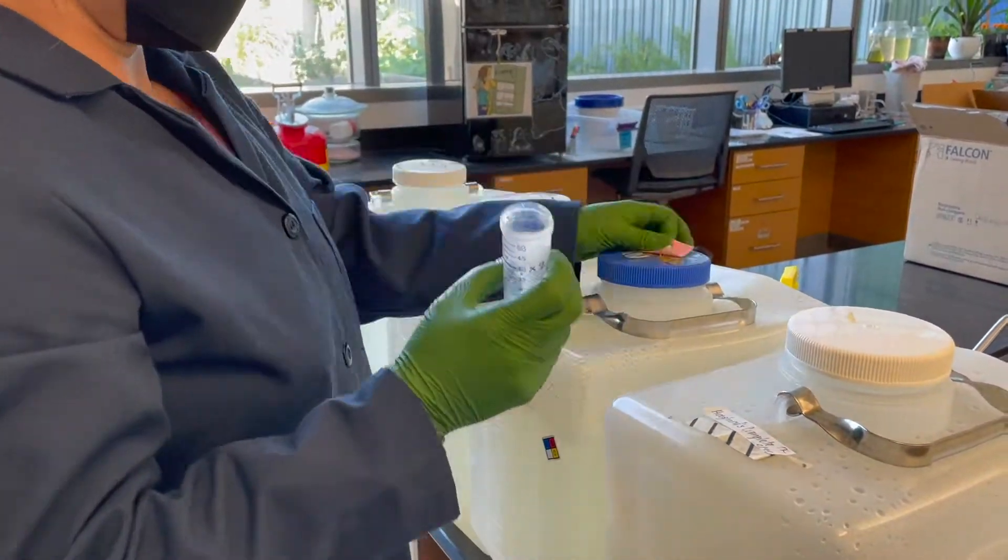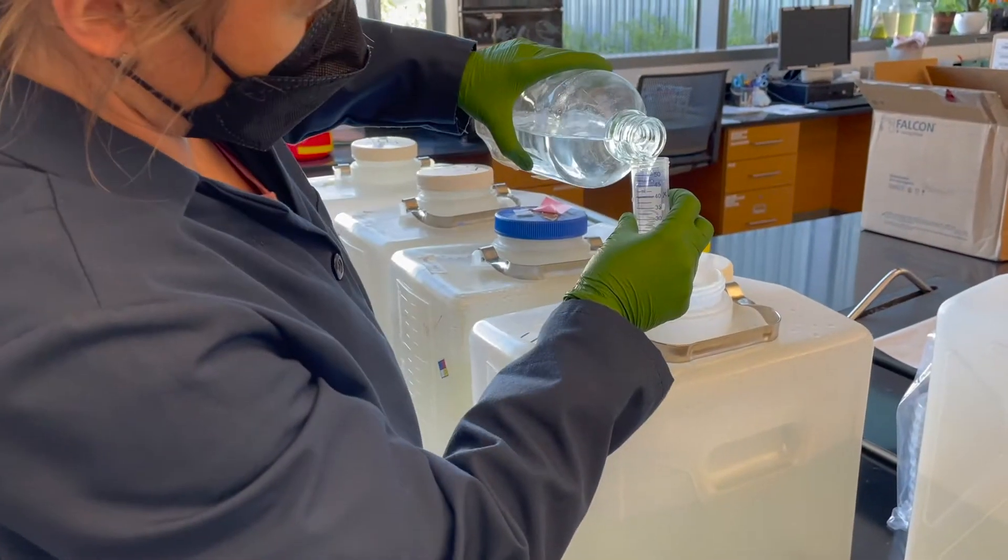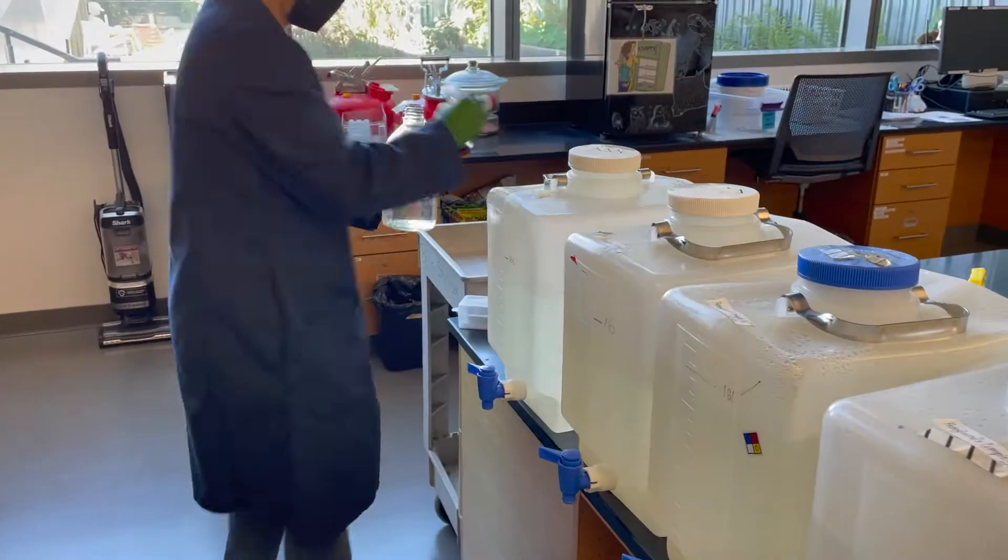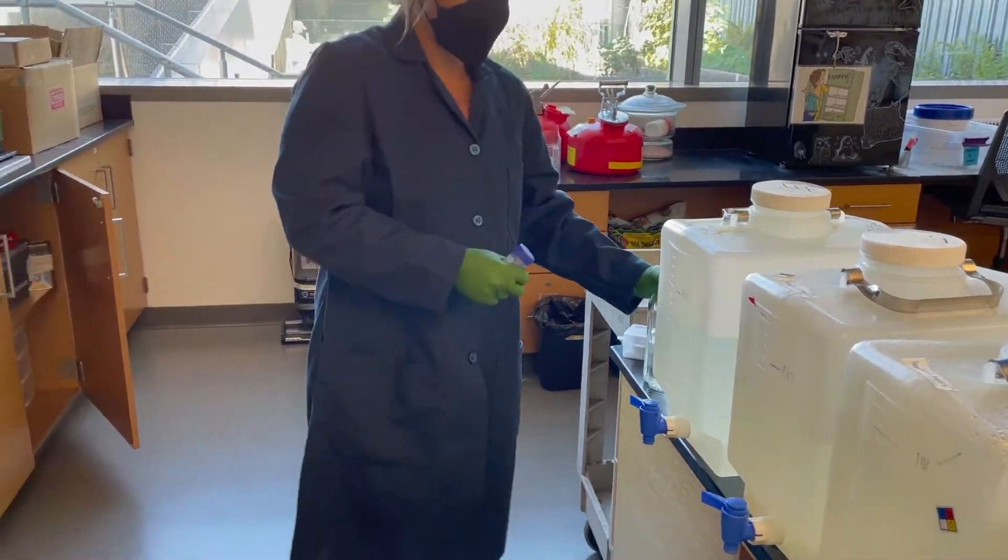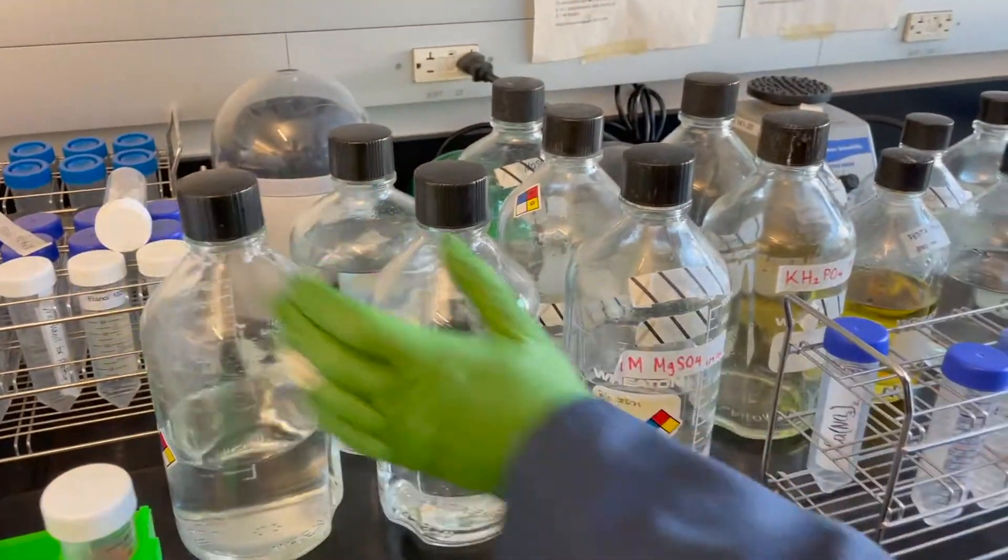Without the post-it, there's no way to tell if the chemical was added or not because the volume doesn't change dramatically and the solution is transparent. Post-it is just an example of a physical cue. You can come up with your own, for example, move the containers or open the lid.